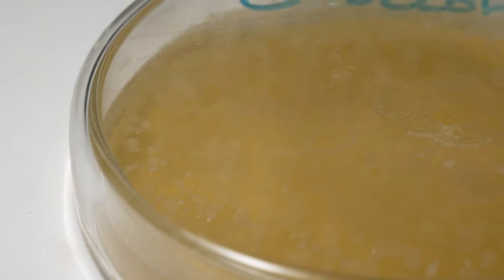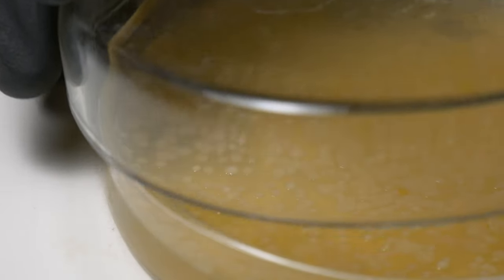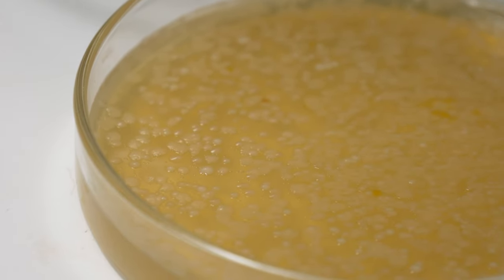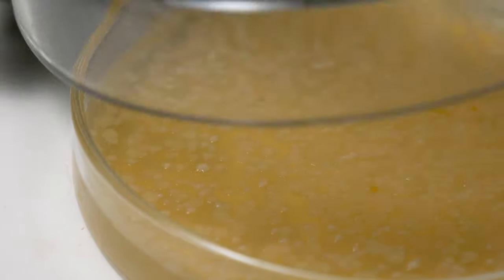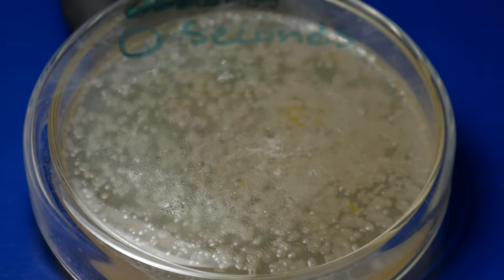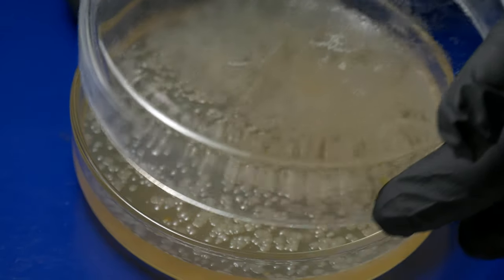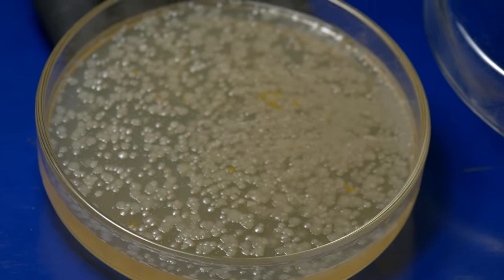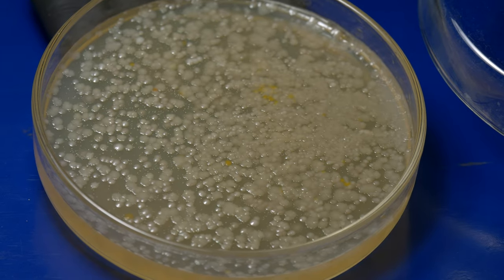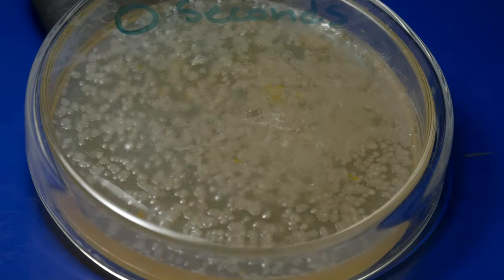Next onto our LB plates — these are just standard recipe LB plates that I put in my garage, which is around 85 to 92 degrees Fahrenheit, which I think was perfect for this case. For zero seconds here, you see a large smattering of bacteria of all different colony morphology types — some that are dark yellow, opaque, and extremely small pin dot colonies. I think I counted around seven different colony morphologies here.